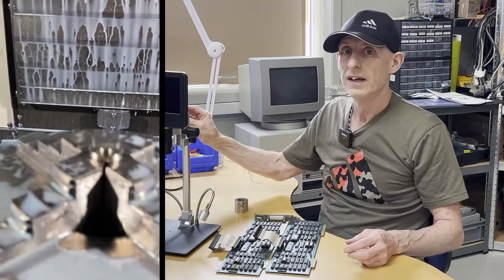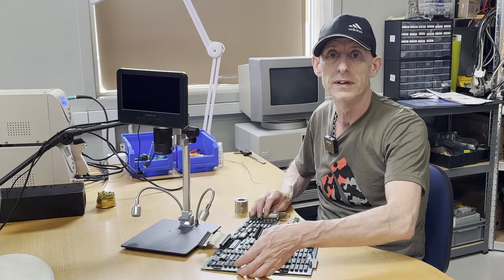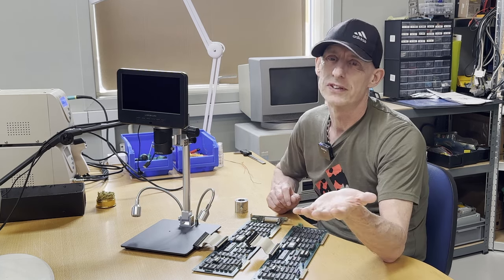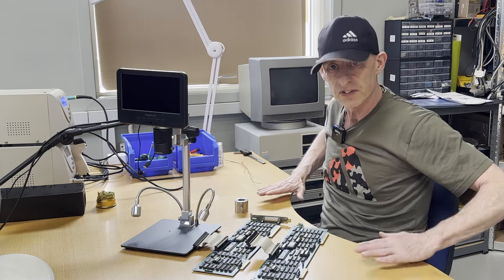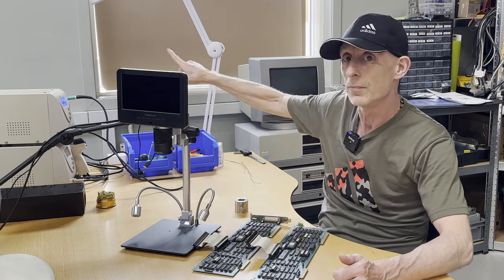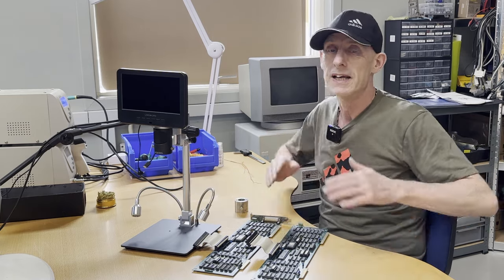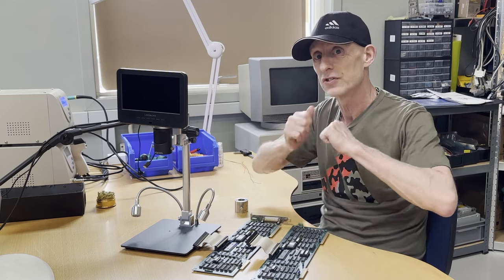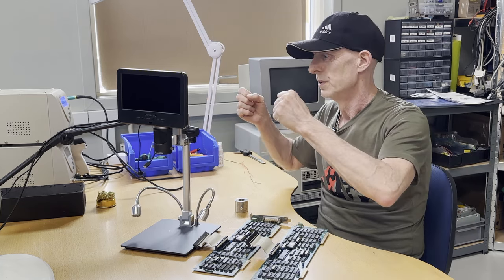We can put this on here and hopefully it won't wobble when I'm on the table. I know a lot of you have been commenting and even some of you have been writing to me - this is why I'm doing this. Obviously the best solution for the actual arm is not to mount it on the table. This is a table that can go up and down and it's wobbly, so this should be mounted on a wall. I cannot have something mounted on my walls here, sadly. So I have to have it mounted to the table - this is why I'm coming up with solution number two, which I hope will benefit other people.